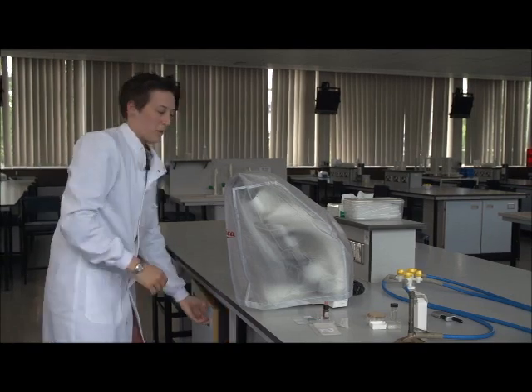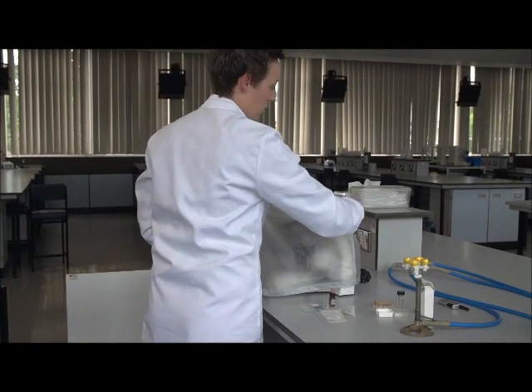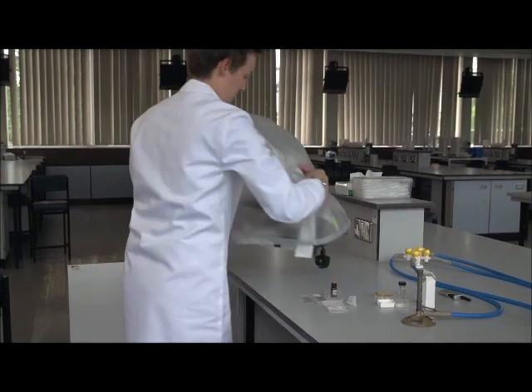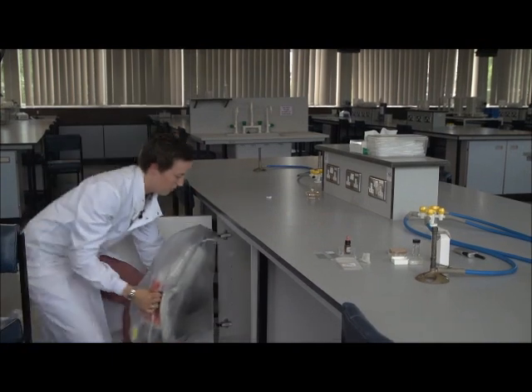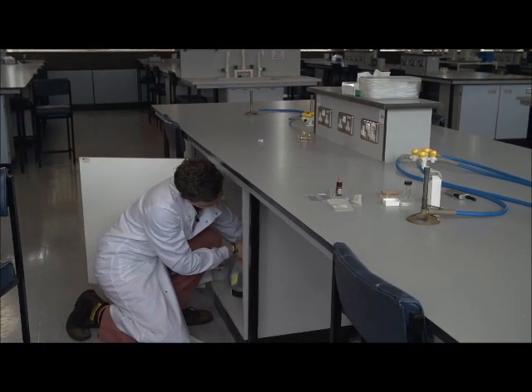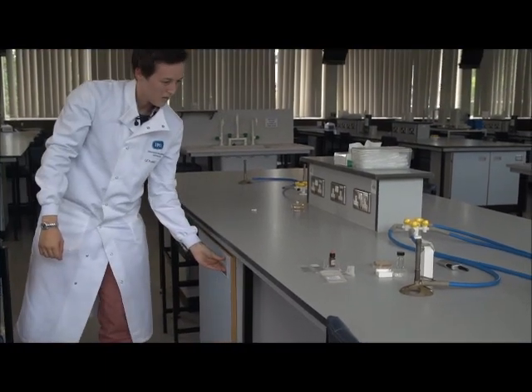We then place the microscope back into the cupboards underneath the benches, again making sure that you hold the handle and the front base. And that's how we use the compound microscopes in the teaching labs.